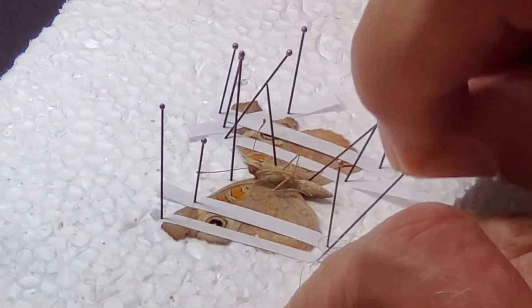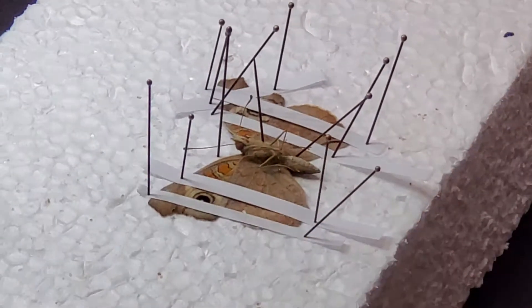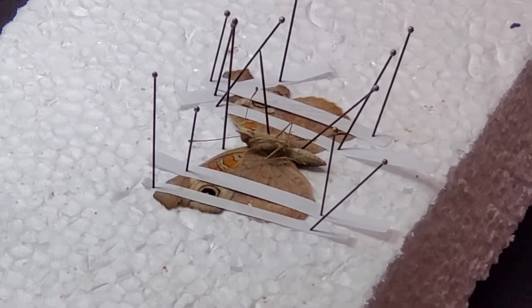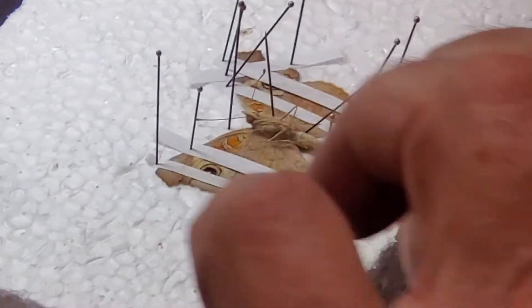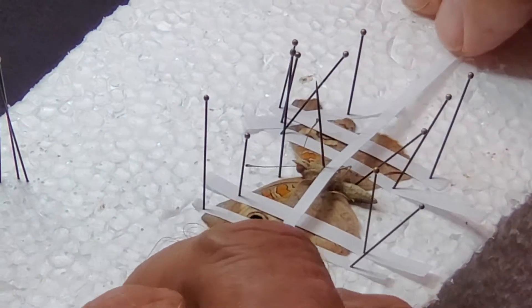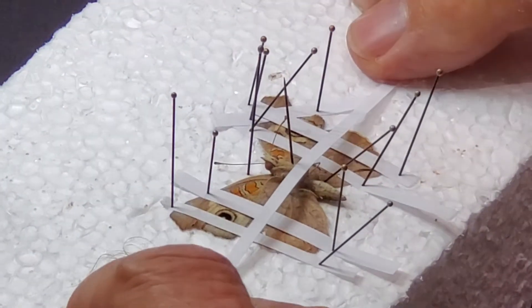Two more things. Occasionally, either the abdomen or the legs, I will have to hold down by having a piece of paper go this way. This particular specimen, I don't really need that.